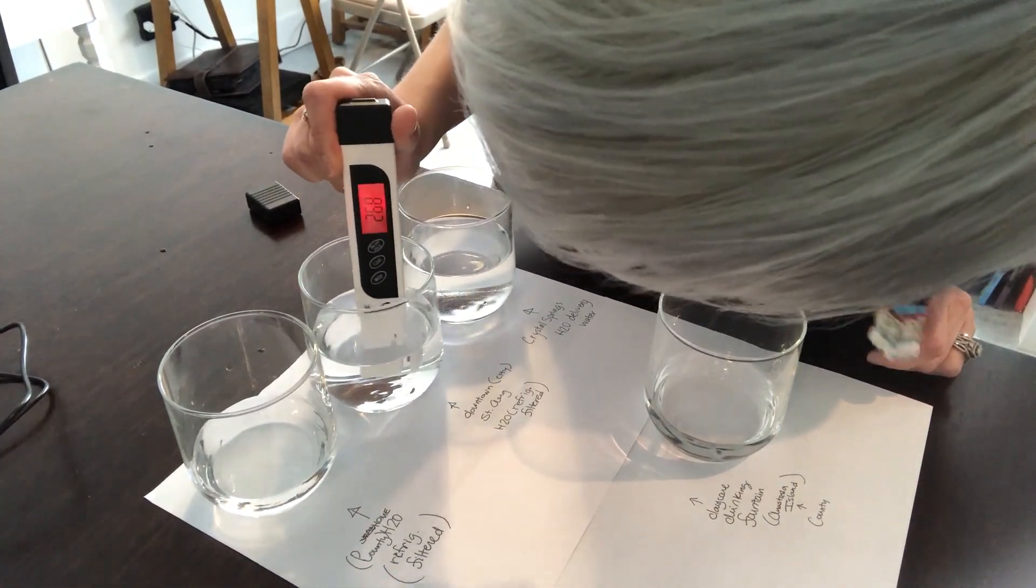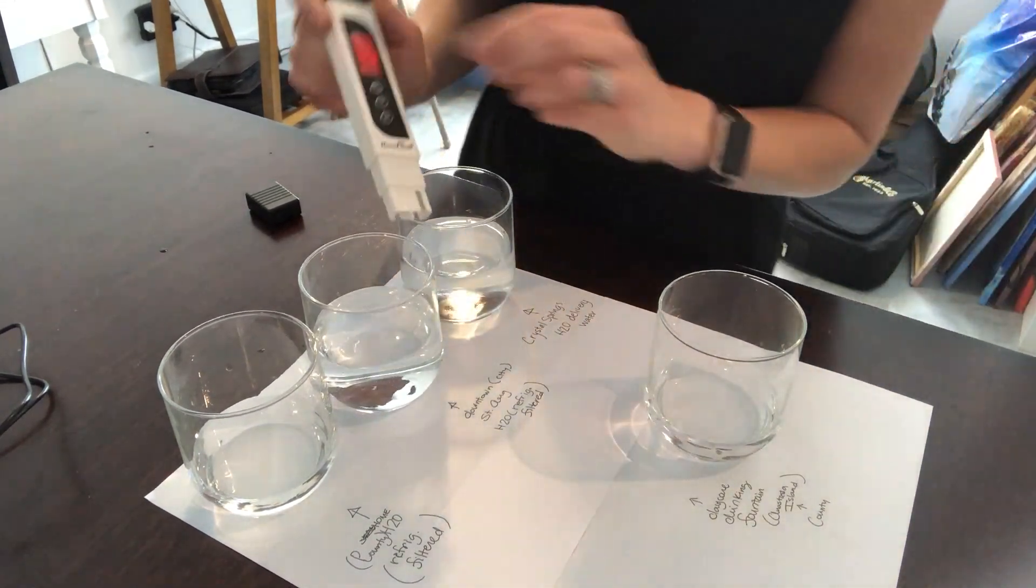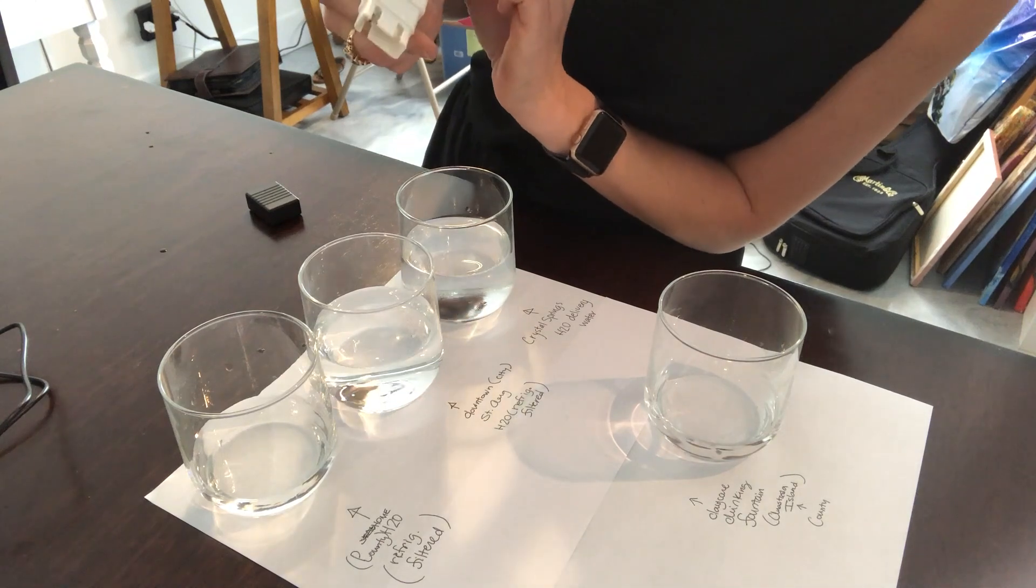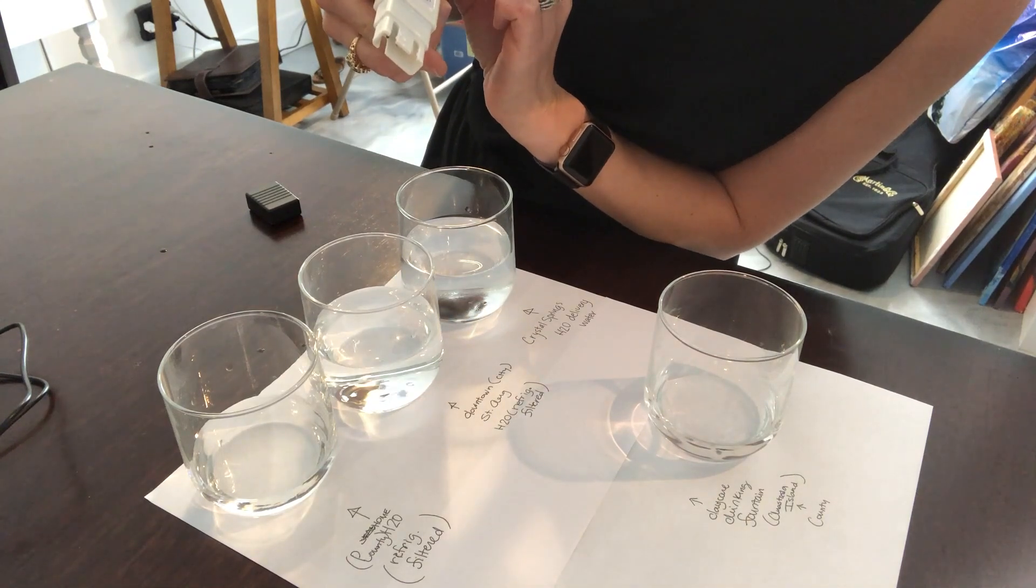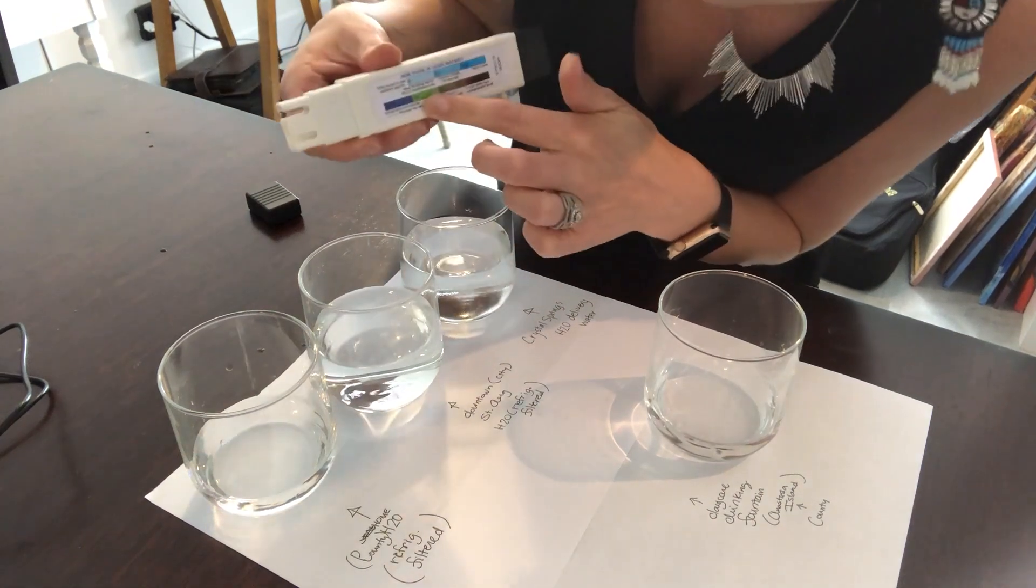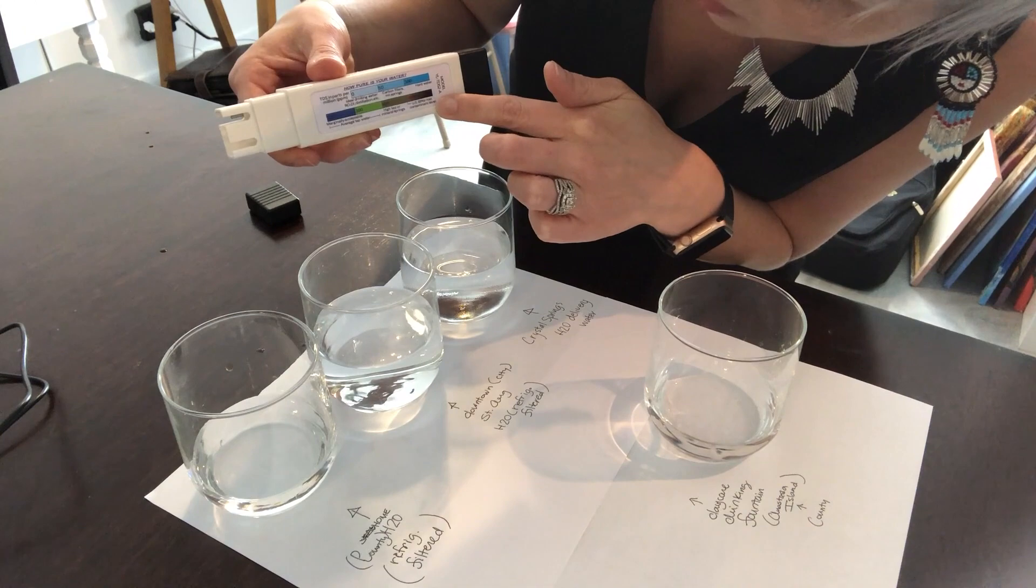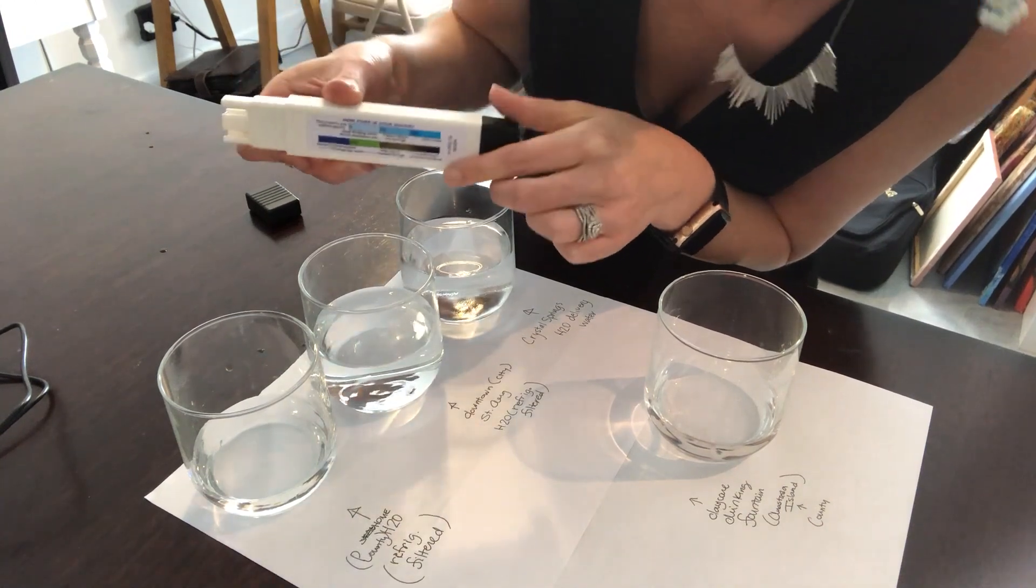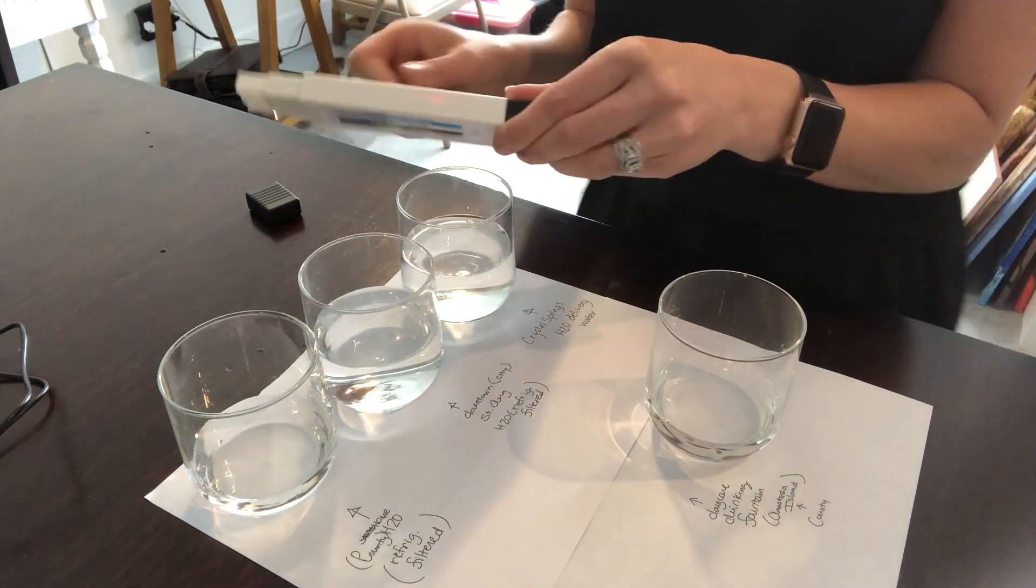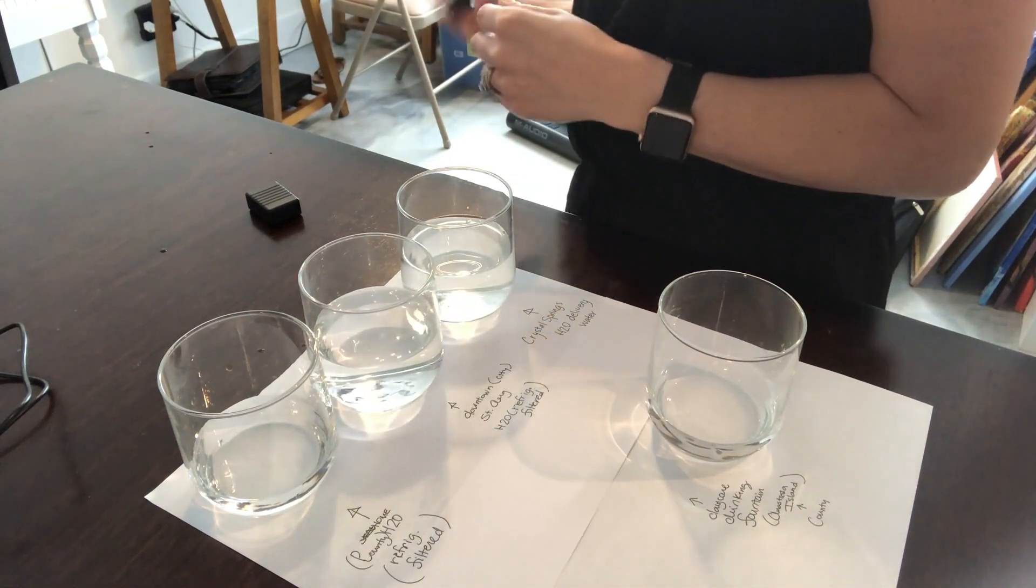It's at 268, so it's not as bad as the county water interestingly, but it's still kind of bad. Here it's calling it marginally acceptable tap water, which is not as scary as US max contaminant level.